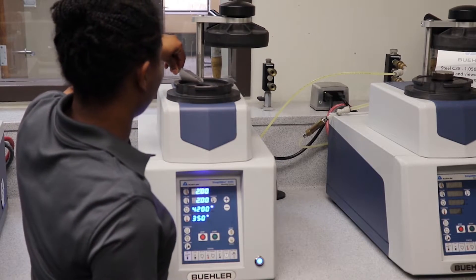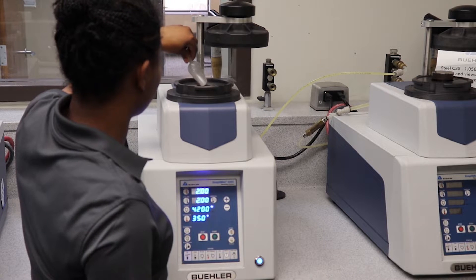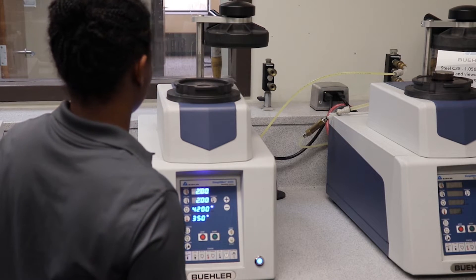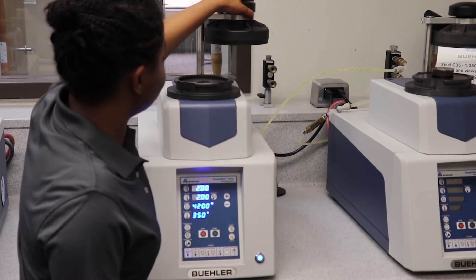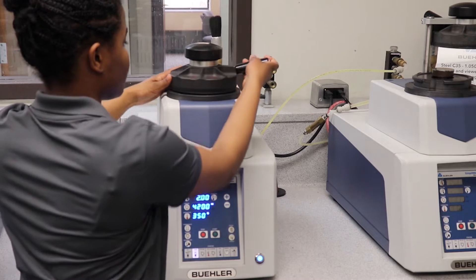The media can then be poured into the chamber on top of the sample. The top can then be rotated, lowered, and locked into place using the handle. Once the status bar shows it is closed, press the start button.